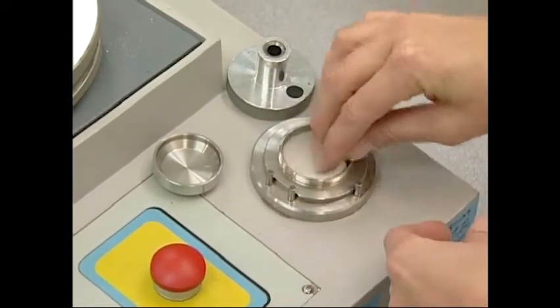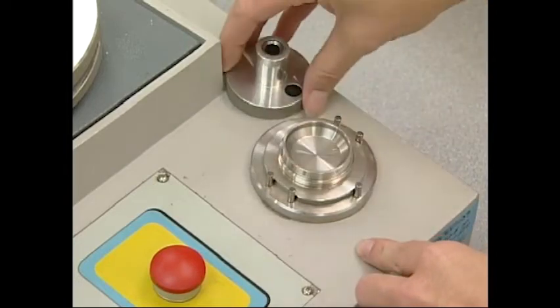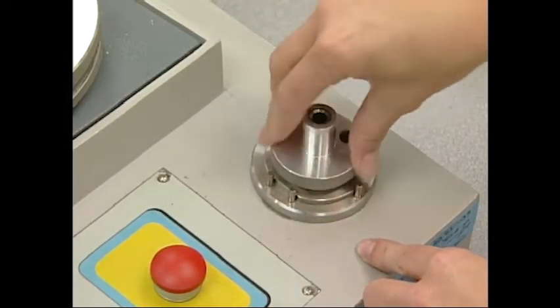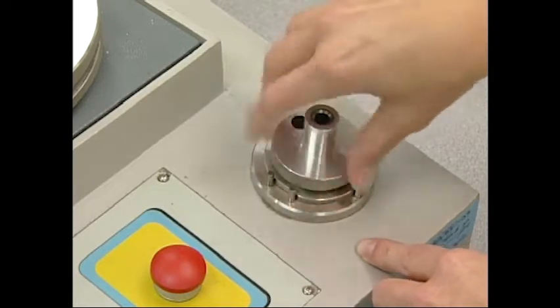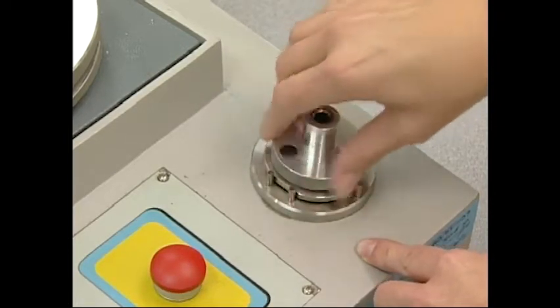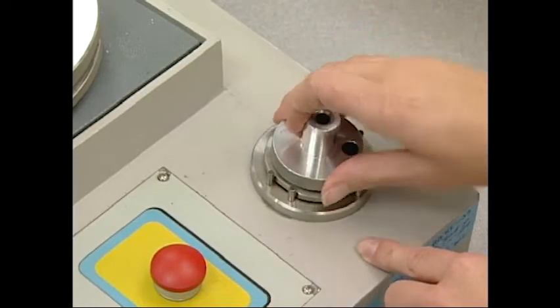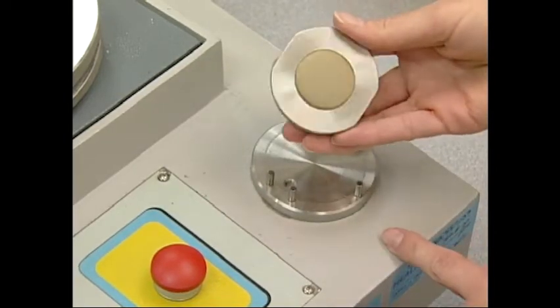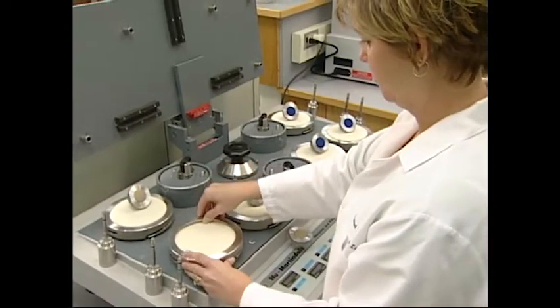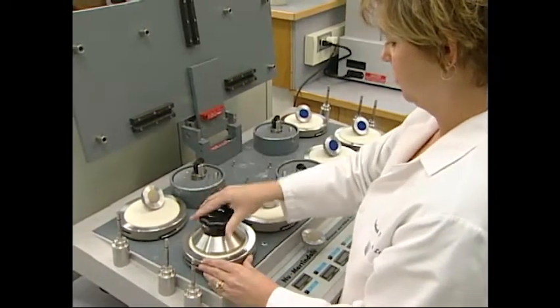Testing conditions include the type of abrasion, the action of the abrasion on the specimen, the tension on the specimen, and other aspects. Finally, the training and judgment of the test operator is paramount in importance.